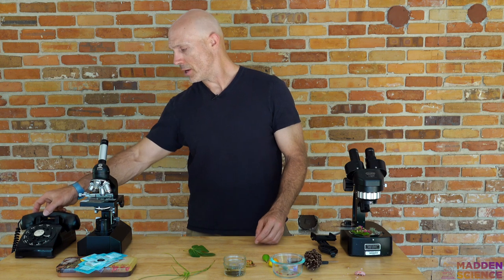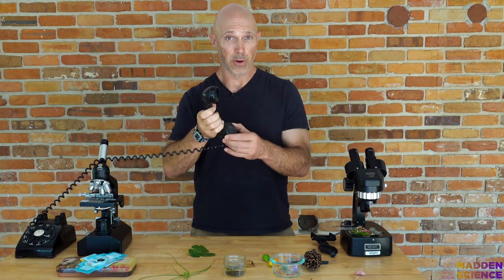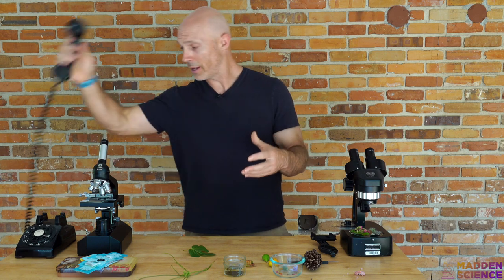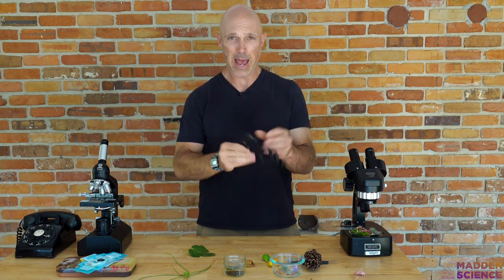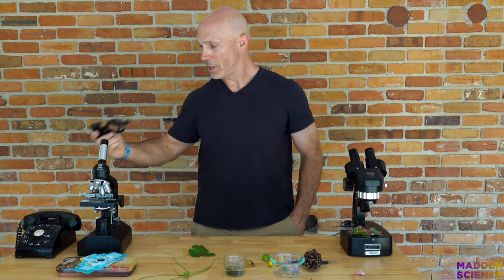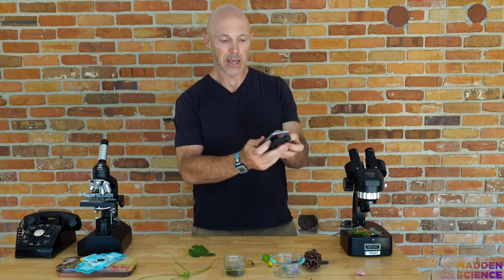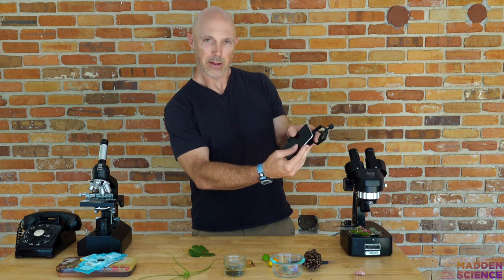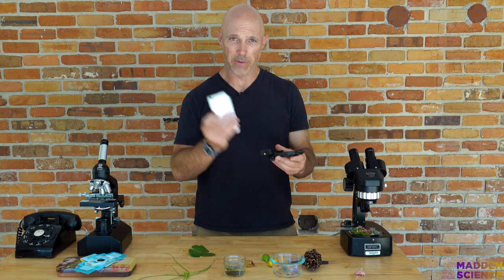What else are you going to want? You're going to want access to your phone — both for viewing things and recording. It might help to have an adapter for your phone so you can hook it up to a microscope, tighten your phone in, and view and record straight to your device.